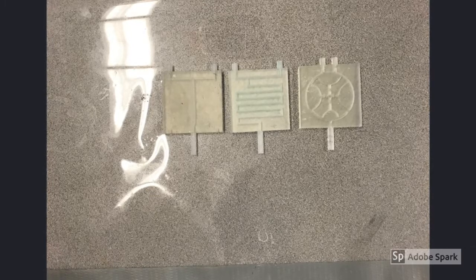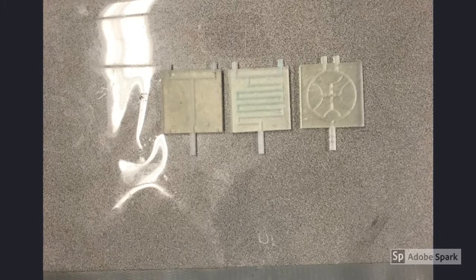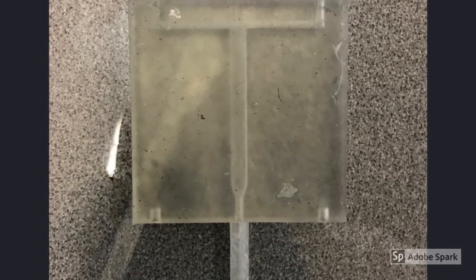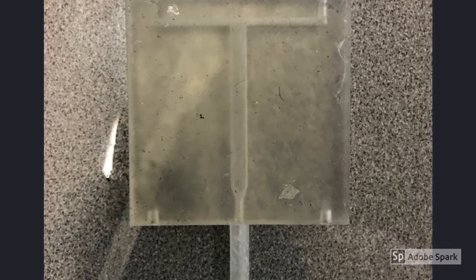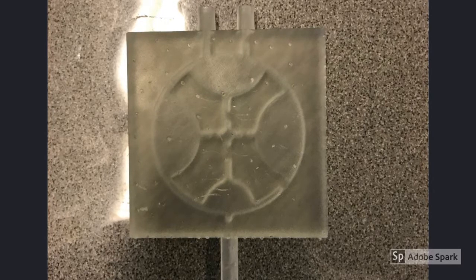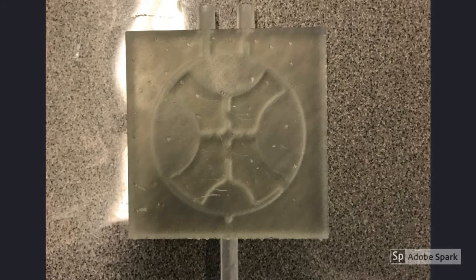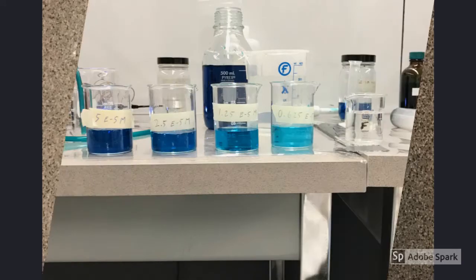The 3 reactors we designed were the T reactor in the SolidWorks tutorial, a snake reactor, and a circular channel reactor. The T reactor had a simple geometry where both reactants met in the middle and formed the product. The snake reactor also has a simple geometry, but with a much greater volume and residence time when compared to the T reactor. The circular channel reactor has a complex geometry as well as the greatest volume and residence time of the 3 reactors, and is expected to yield the highest conversion of malachite green.